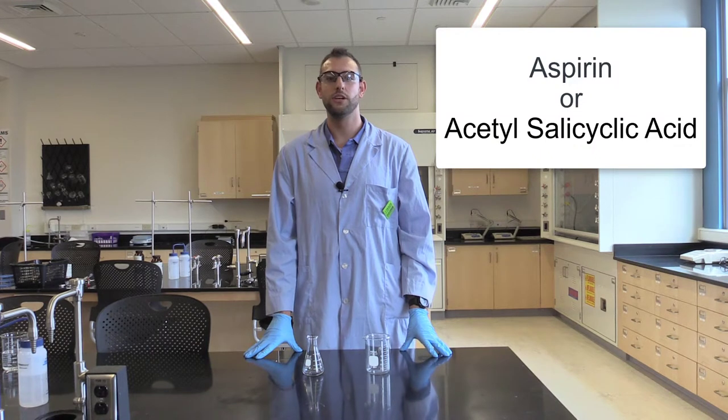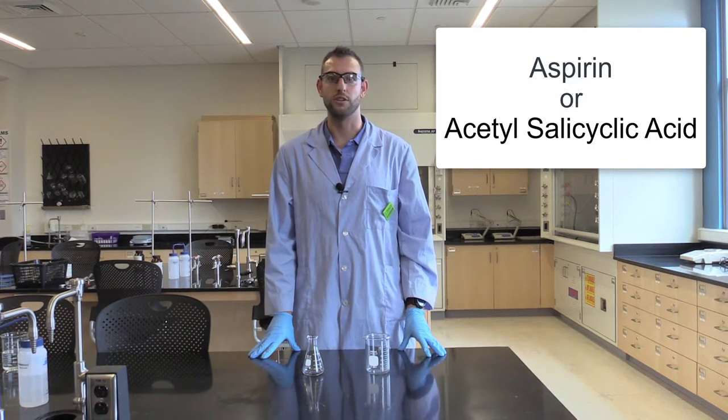Hi everyone. My name is Dr. Scott Melidio and today we'll be going through how to make aspirin.